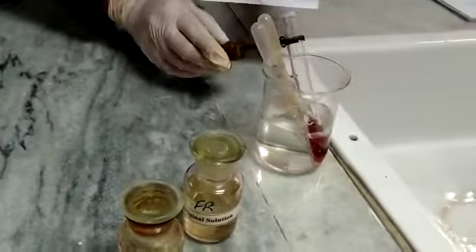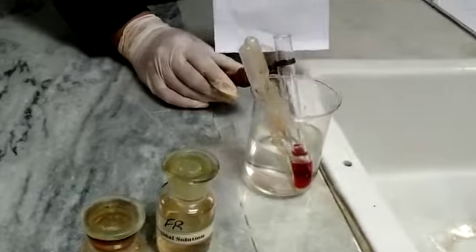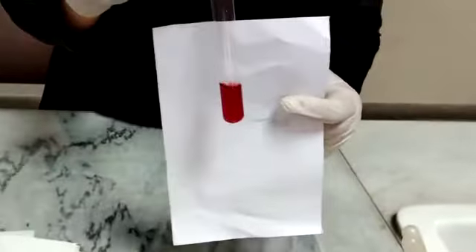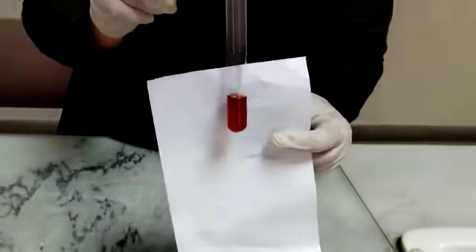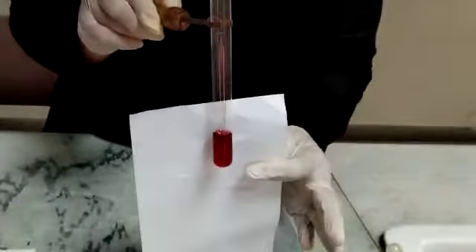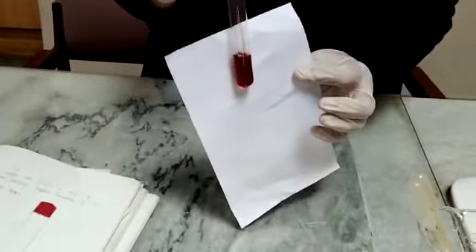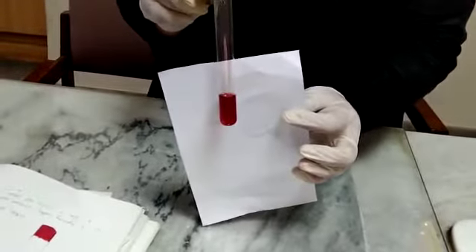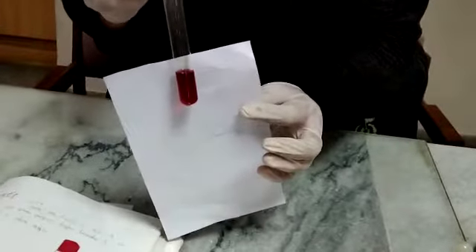On cooling the solution — either by placing it in a water bath or under tap water — you can see the appearance of cherry red color in the test tube, which confirms the presence of keto sugar in the given solution. The original solution here was fructose, which confirms the keto group in it. This is your interpretation of the Seliwanoff's test: it confirms keto sugar in a given solution by producing a cherry red color.